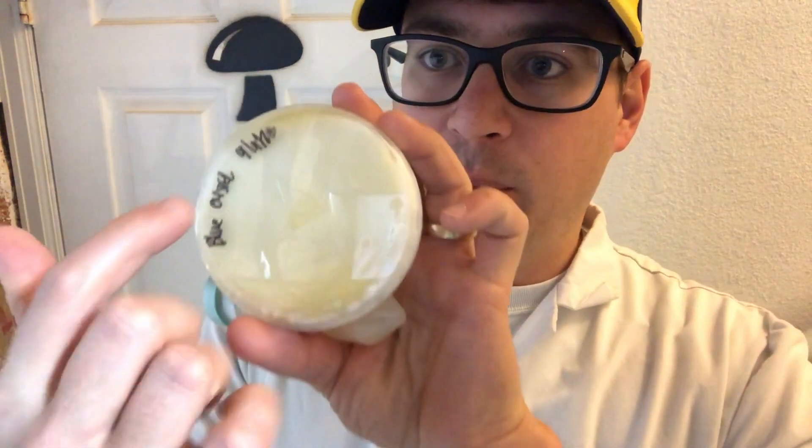It's always good to label your plates on the bottom — the agar side — for that reason. If you're carrying a big stack of plates and drop them, the lids go everywhere. If your lids are labeled, you won't know what mycelium is what, and that could cause a lot of heartache.